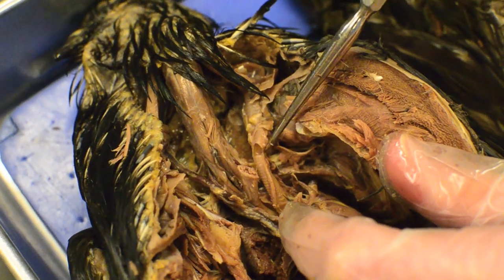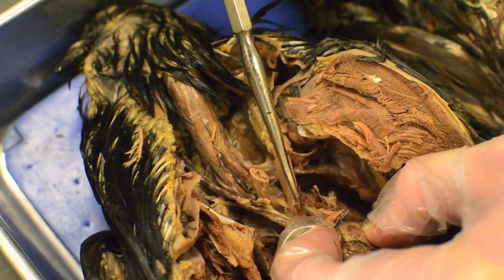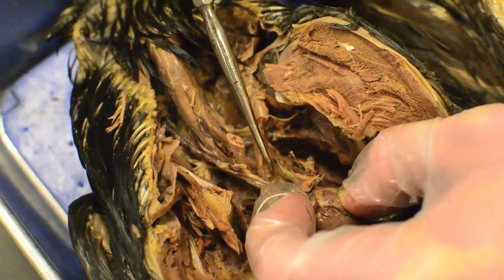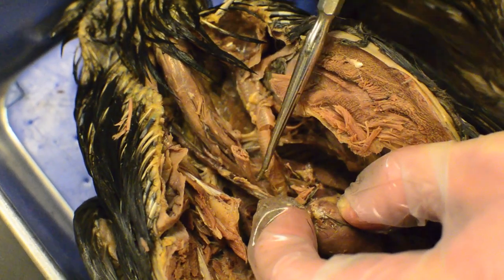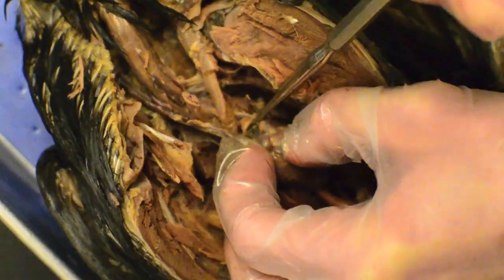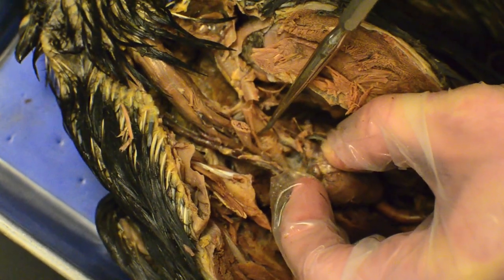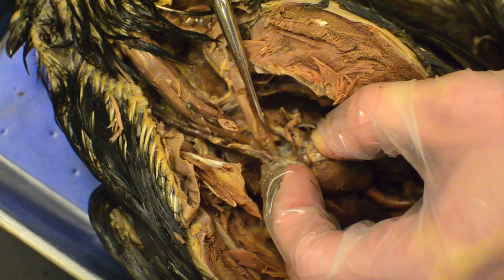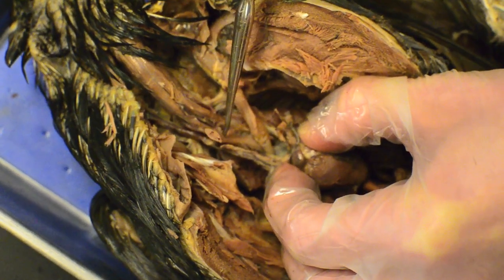It's been cut, but kind of in the heart area there's a pattern that changes right before it splits. This is the syrinx — this is where the bird makes its sound. Can you see how it changes pattern there? It's kind of under the heart.